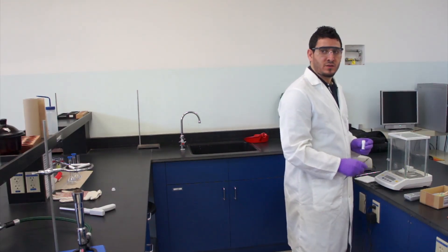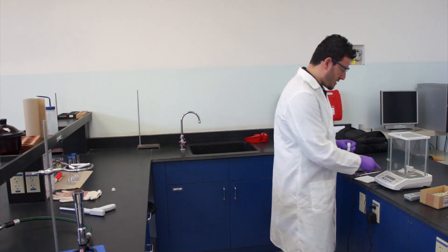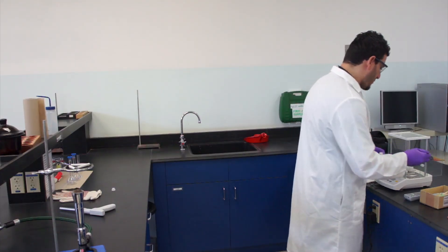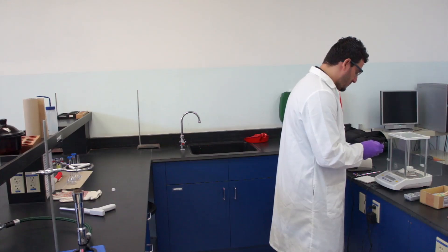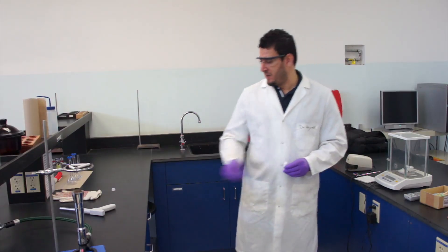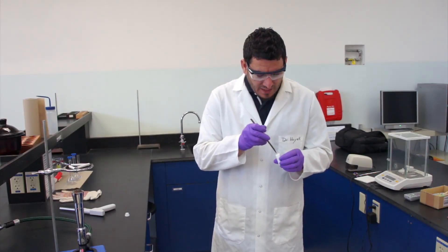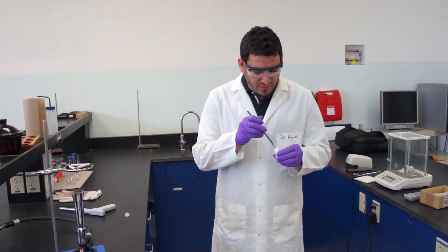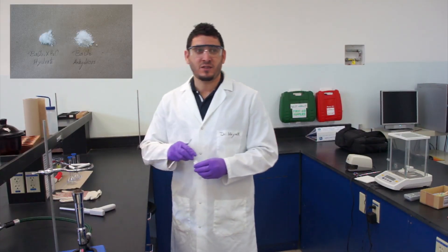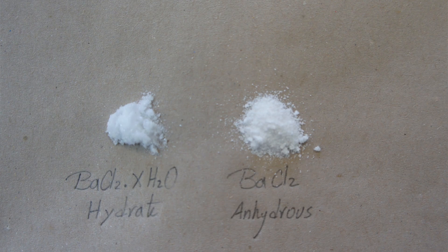You will be weighing around 2 grams — it doesn't matter if it's a little bit less or more. Look at the mass of the crucible and lid and add about 2 grams. For example, if I have 39.2, I'll add until 41.2, giving me a mass close to 2 grams. Here I have 41.3, meaning the hydrate mass is close to 2.1 grams. When you touch the hydrate, the solid particles are kind of sticking to each other because of the water — it's kind of wet but not very wet. You will see the difference later with the dry powder after heating.